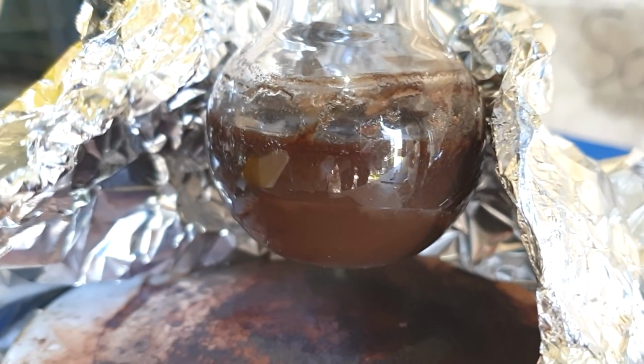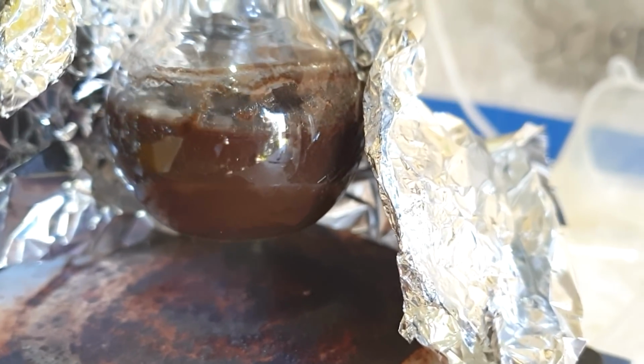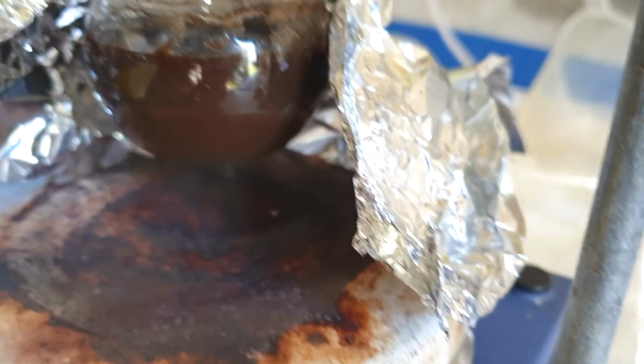Just done 3 hours on the reflux there, and there's precipitate at the bottom. You can kind of see that spun around. So hopefully that's our sodium bromide that's precipitating out, because as that sodium hydroxide pulls off the bromides on the organic molecule, it'll form sodium bromide, which isn't soluble in the ethanol. And that's a good sign.